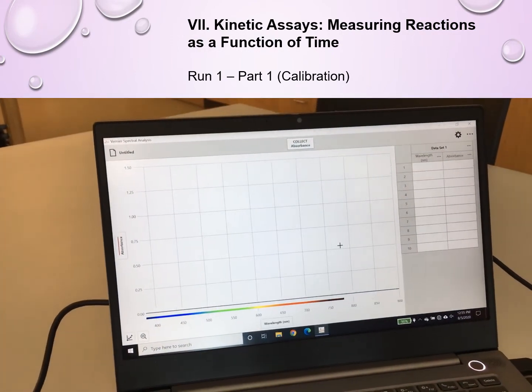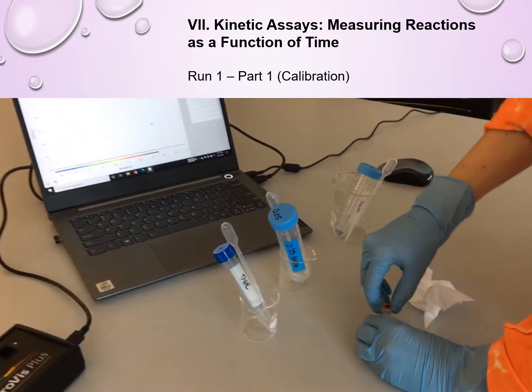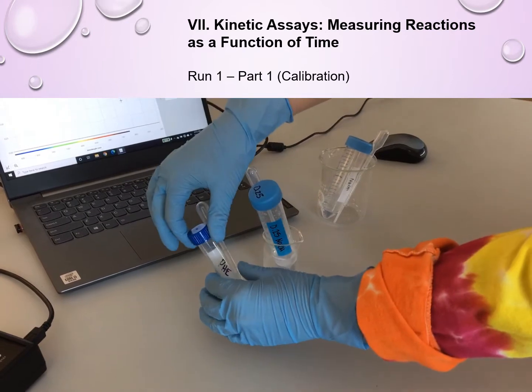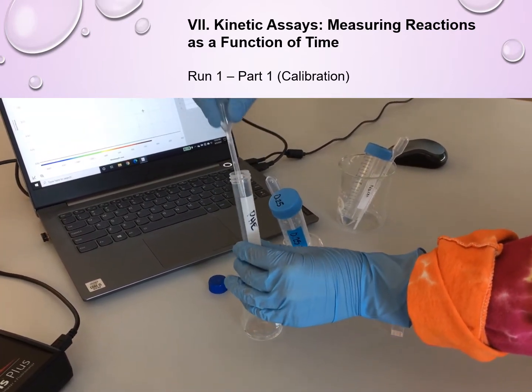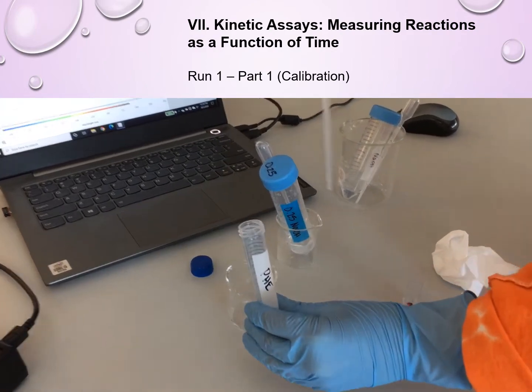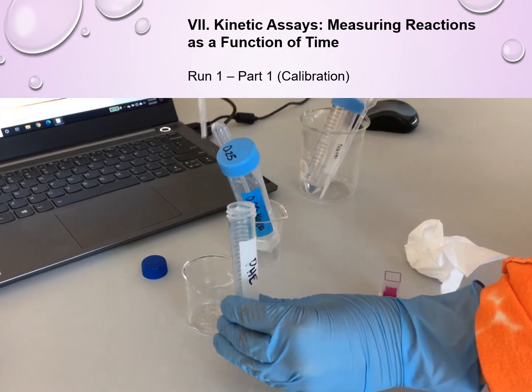Calibration is now complete. So now we want to add in a drop of phenolphthalein, which is what Emily will do in a second. And you'll see formation of a beautiful pink color.